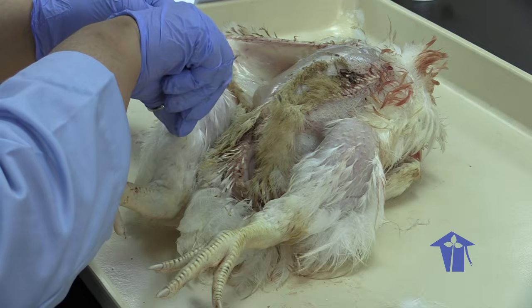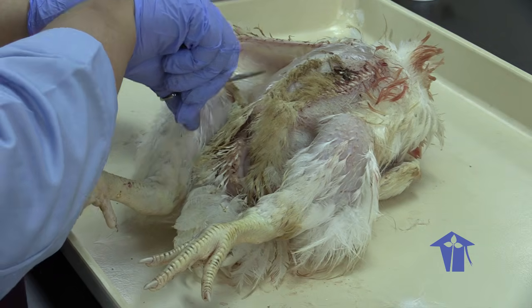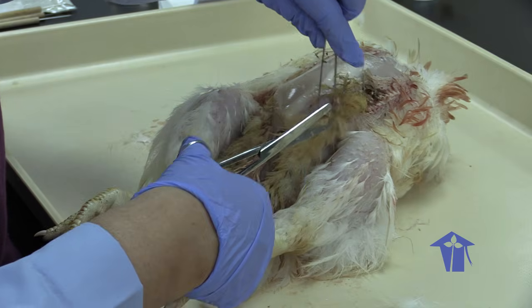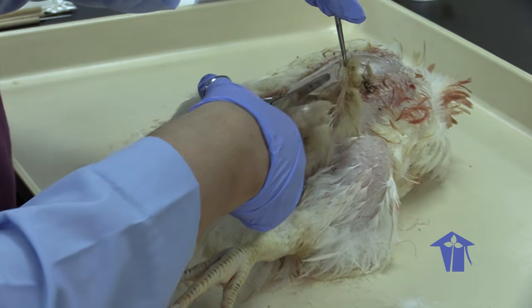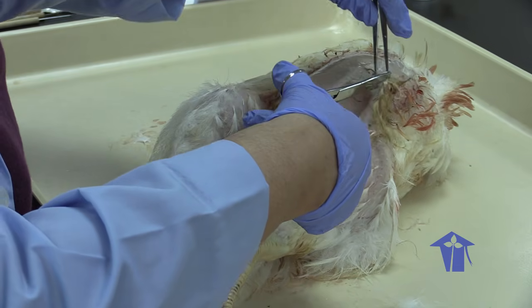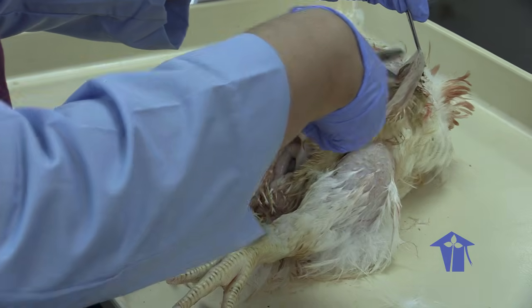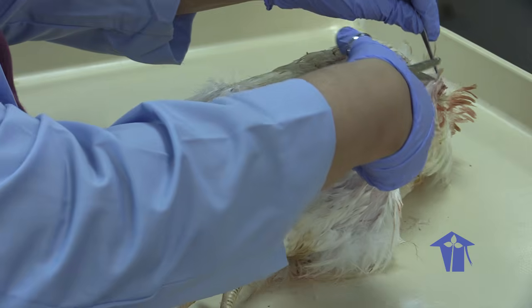And you can actually see some veins on the skin because the skin has to be vascularized as well. As we will see when we're looking at temperature regulation, skin is a majorly important part of keeping our bodies warm and getting rid of extra heat.